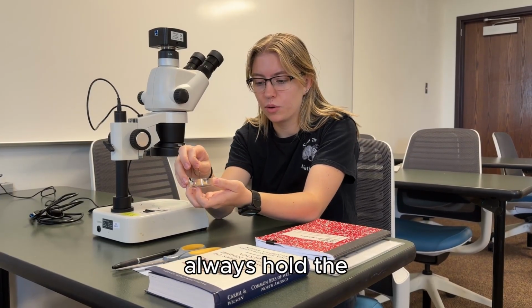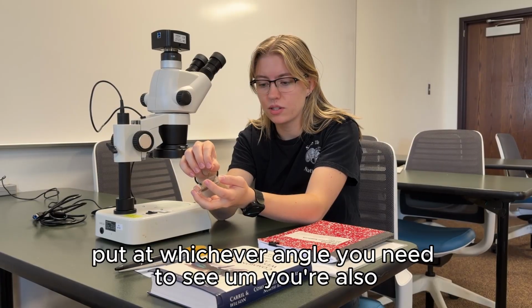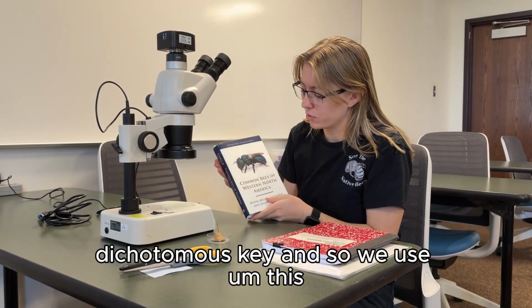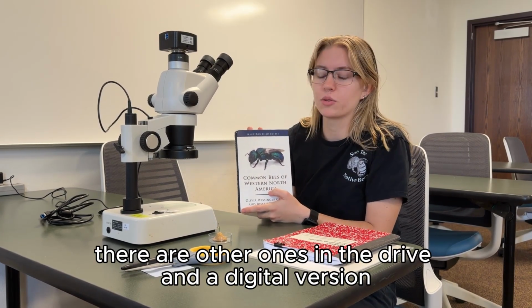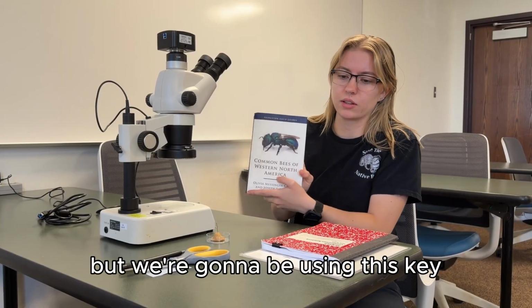So always hold the head of the pin, and you can put it at whichever angle you need to see. You're also going to need to use your dichotomous key, and we use this specific one the most. There are other ones in the drive and a digital version of the same one as well, but we're going to be using this key.